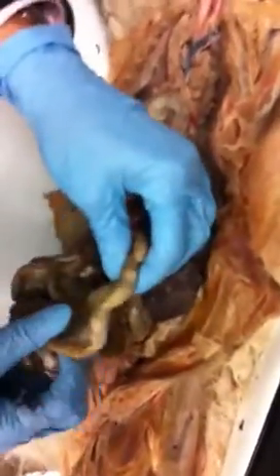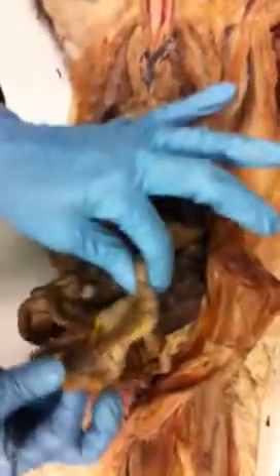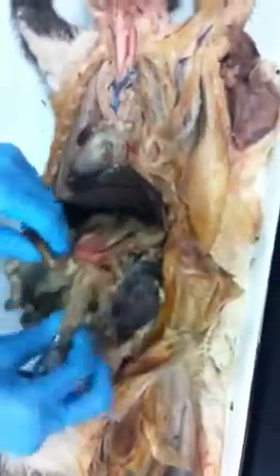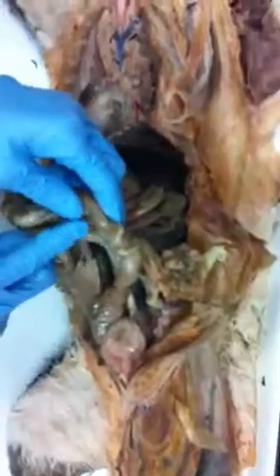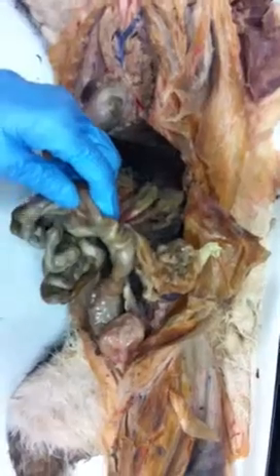Okay? So we go all through the jejunum, and then this last couple of centimeters. What is this right here? I'll tell you in a second. Okay. This last couple of centimeters of small intestine is the ileum. And the ileum leads to the large intestines, which is all this stuff. There's less of it, but it's larger in diameter.